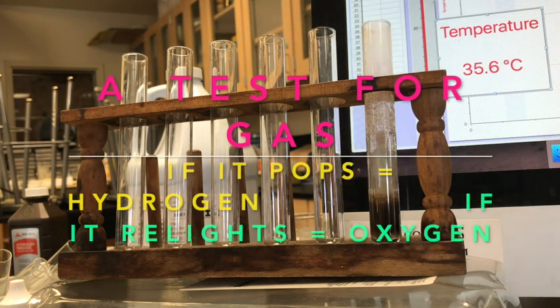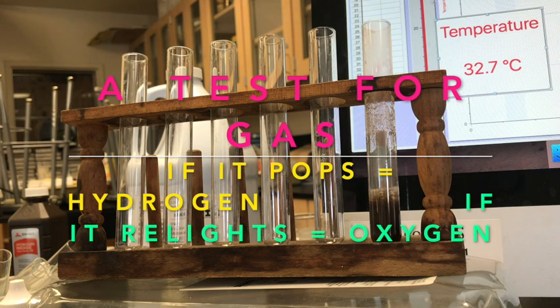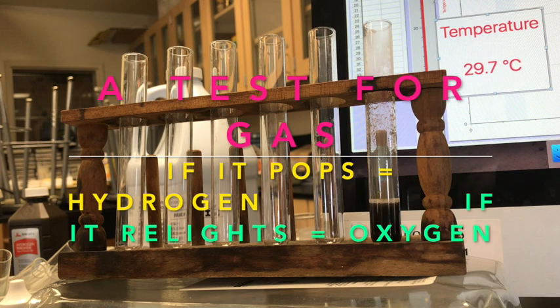Nice. So one of the tests is to see if you can get a popping sound, and you don't. But if you put a match in there and it relights, that means that you have oxygen being produced.